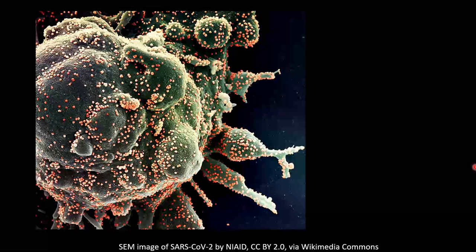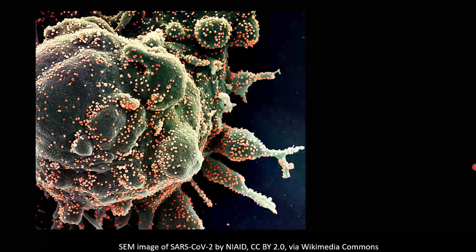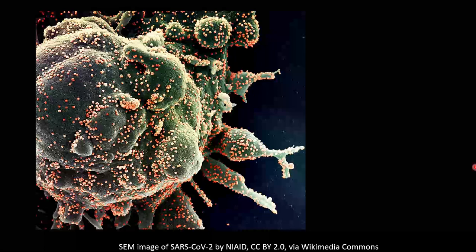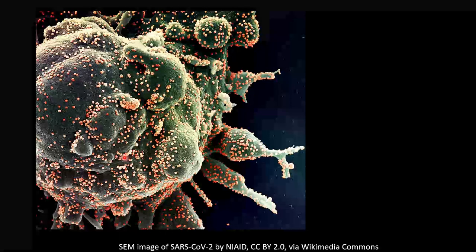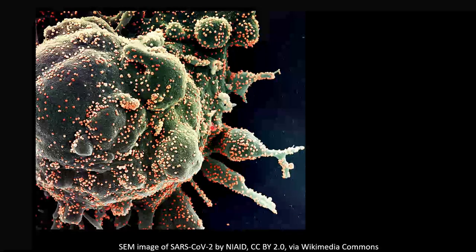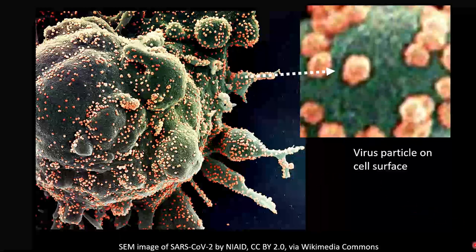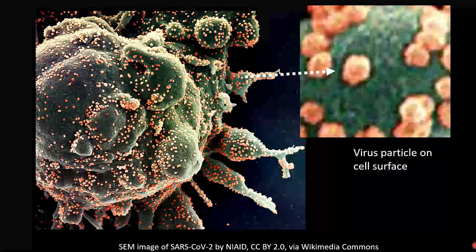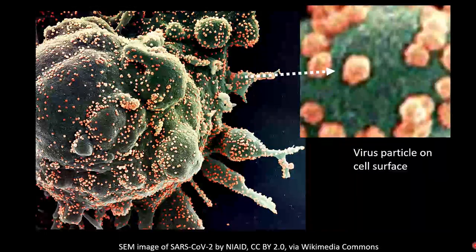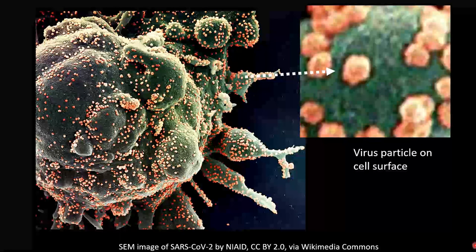This image highlights that further. They actually gave some details of how they prepared it. They had two pools of cells — one treated with coronavirus and one that wasn't. They put those cells on a scanning electron microscope and could see that the infected cells had these little orange nodules. Experienced microscopists could identify those nodules as coronavirus, with one individual coronavirus budding off the surface of the infected cell. The comparison between uninfected and infected cells told them what they were looking at, but to the untrained eye it's not necessarily obvious in black and white.